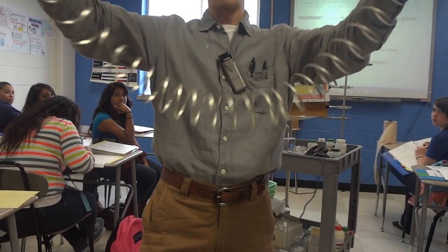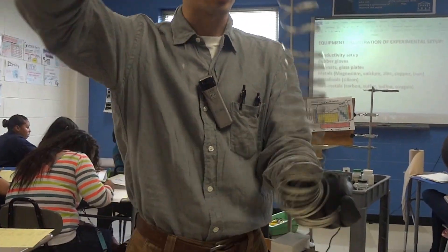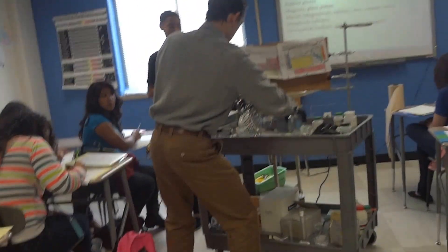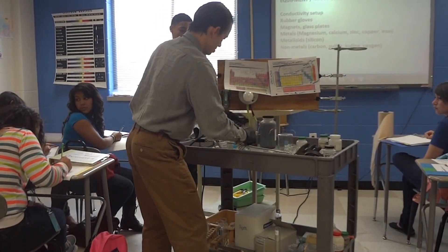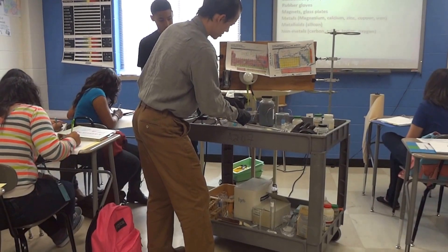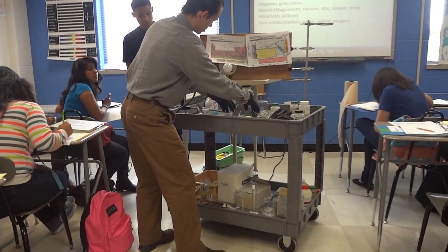This magnesium is ductile — it can be made into a wire — it's malleable, it's shiny, it has luster, and it's kind of silver in color. Now let's go ahead and touch this on the two wires. Make a hypothesis: will it conduct, yes or no?